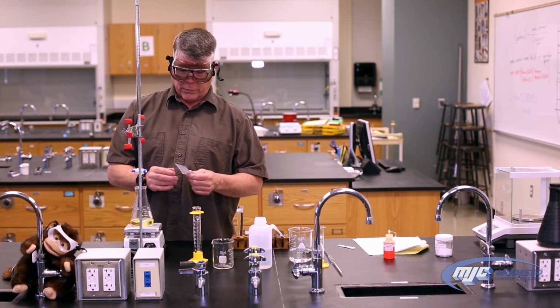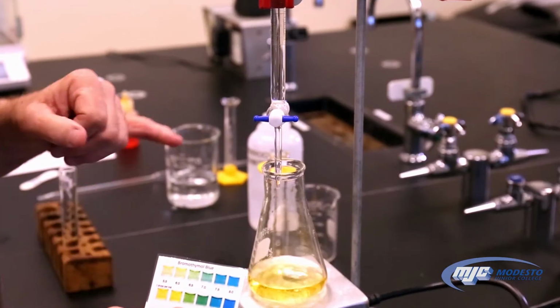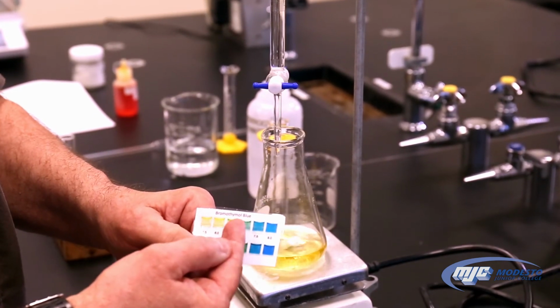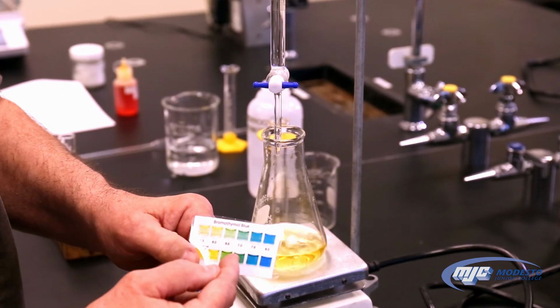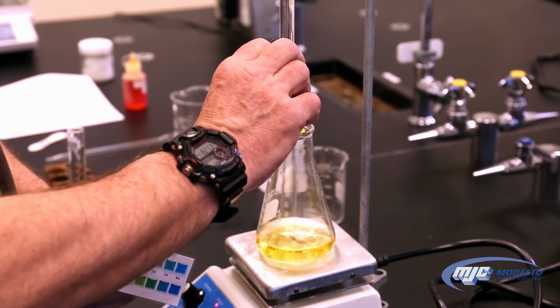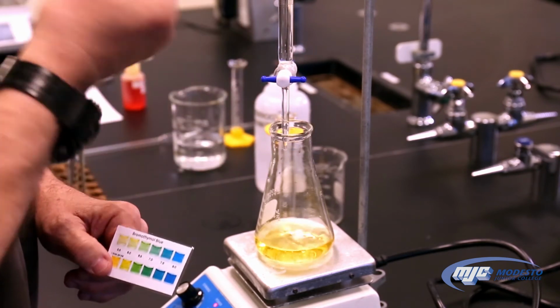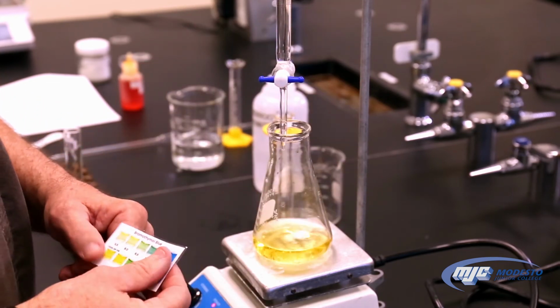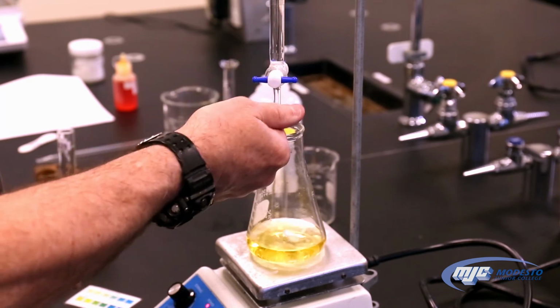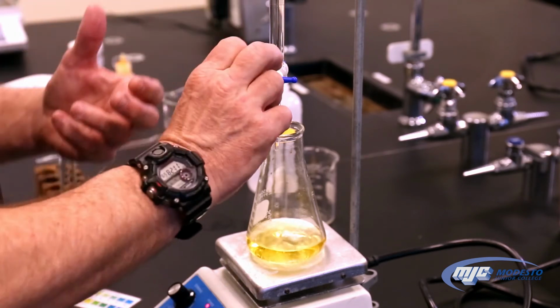Now, the indicator, bromothymol blue, changes color when we get to our equivalence point. You can see now, I think that it's a yellow color. We're looking for it to change to about that color right there, a green. Sometimes it goes right from yellow to blue, and that's okay. The point is, we want to be as careful with our titration, with our buret additions, as we can, so that one drop makes it go from yellow to either green or blue. Now the way we do that with the buret is we twist this stopcock 180 degrees. The faster we twist it, the slower we go, because we add less with a fast twist.